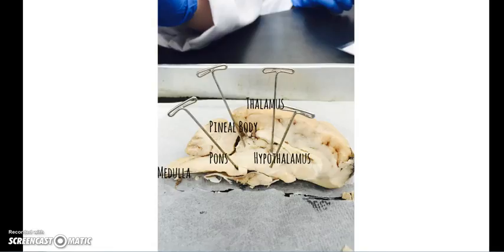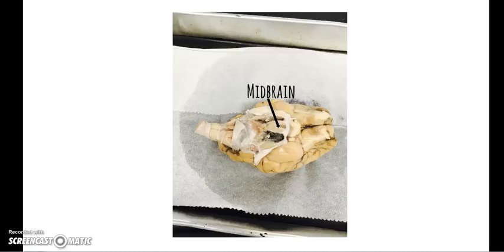It is known as the third eye and controls the sleep-wake pattern. The pons serves as a message station between several areas of the brain. It basically transmits messages. The medulla oblongata is located in the lower half of the brainstem and controls digestion and involuntary actions like breathing, heart rate, blood pressure, vomiting, sneezing, and coughing. The midbrain's function is body temperature regulation, motor control, and sleep cycles.